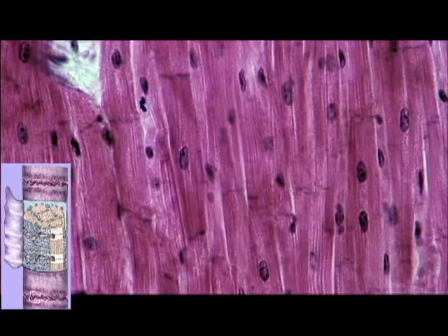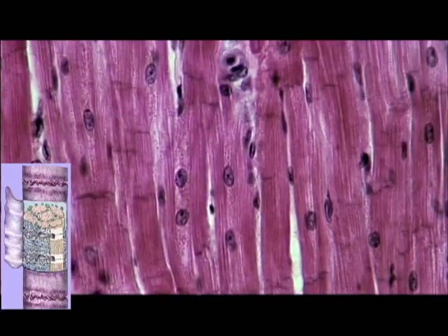As the slide is scanned, notice the similarity in the structure of the contractile cells. Notice that these cells, unlike skeletal muscle fibers, are lacking nerve fibers, motor fibers, and their associated neuromuscular junctions.